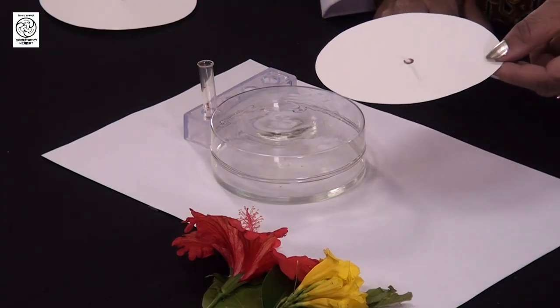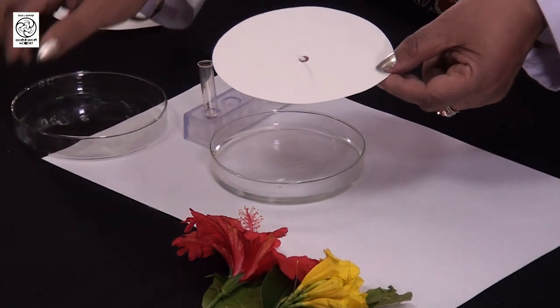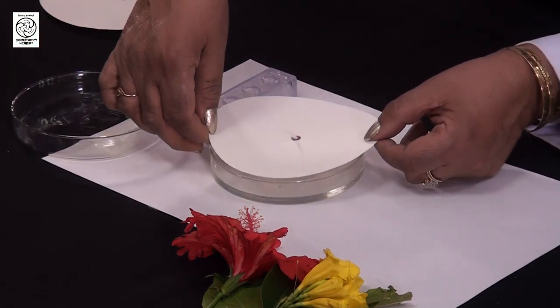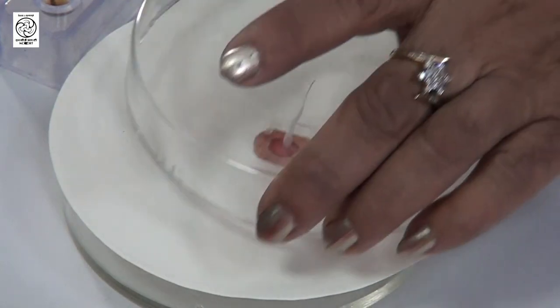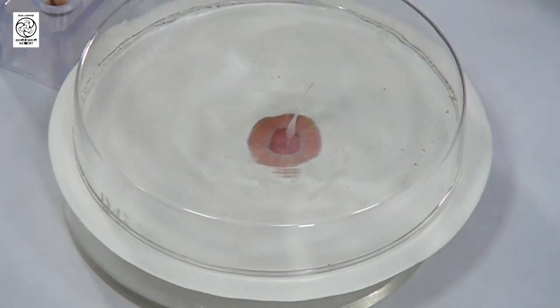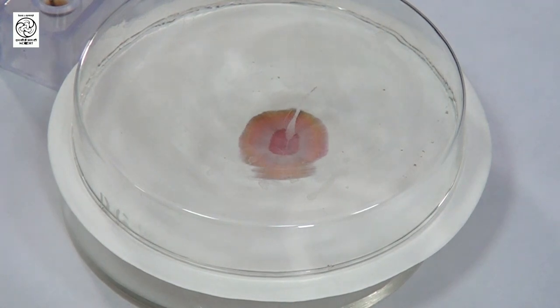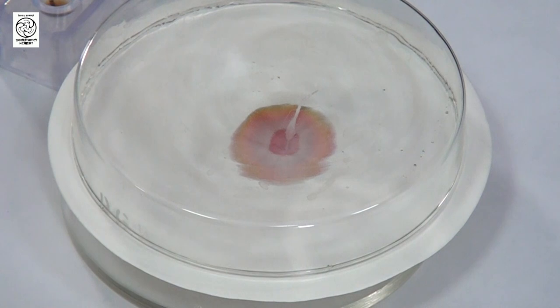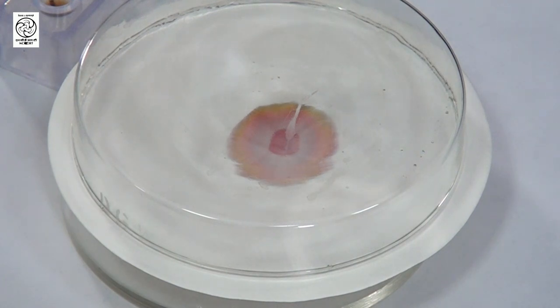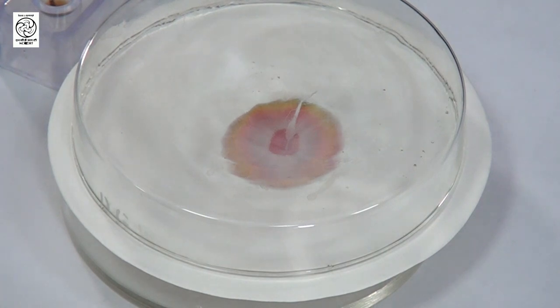Now I will carefully take this filter paper and very carefully place it here, then cover again very quickly. You can see that the lower part of the wick is already dipping in the water which is the solvent we have taken for this mixture. Water will rise slowly from the wick by capillary action, touch the spots of the mixture, and differentially carry along with it the different components of this mixture.